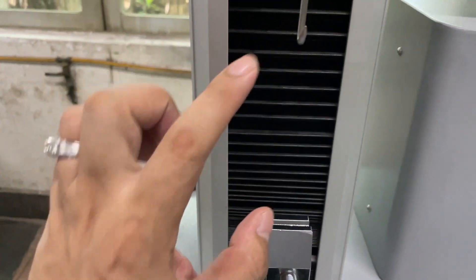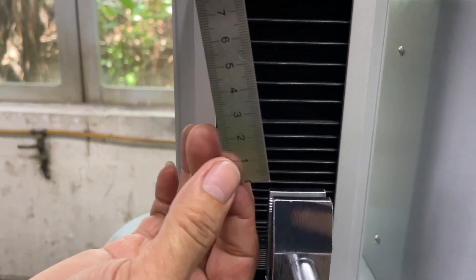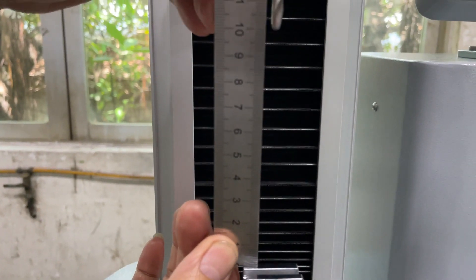It will return to 100. Check the height is 100 or not — now it's 100.